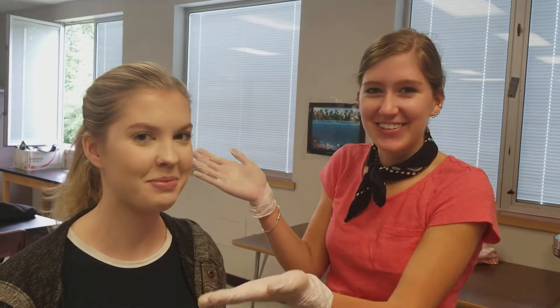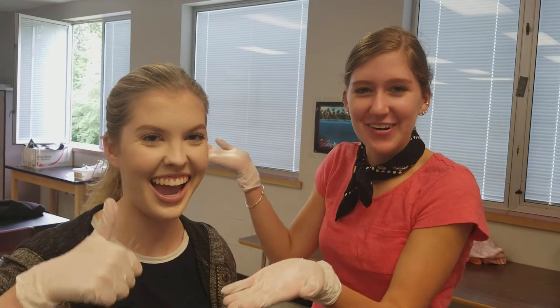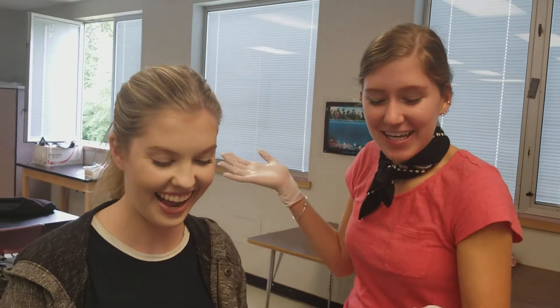Hi, it's Dr. Meg here for Anatomy 101. Today my guest star is Dr. Aaliyah. She will be going over the internal of a fetal pig.